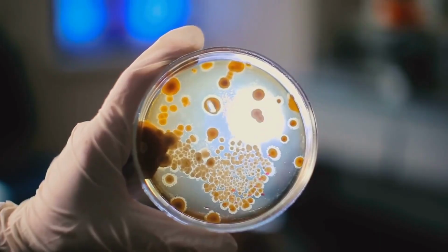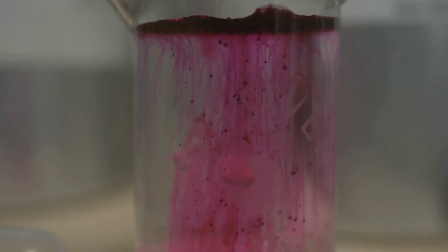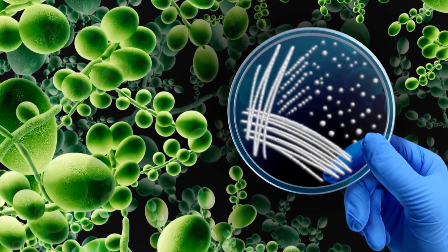Microbes reveal their identities in the media. It's like a puzzle, and every test result is a building block. As you observe each color change, bubble, and reaction, you're getting closer to solving who the organism really is.